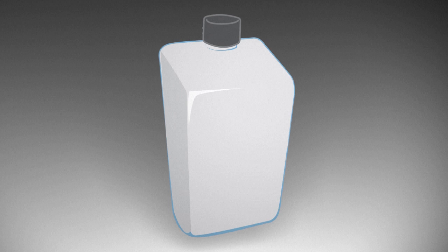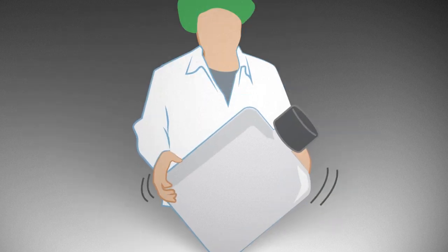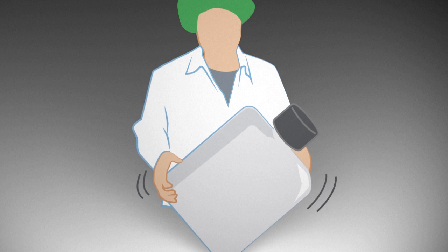Close the recipient quickly to avoid evaporation. Mix the preparation by gently shaking the contents.